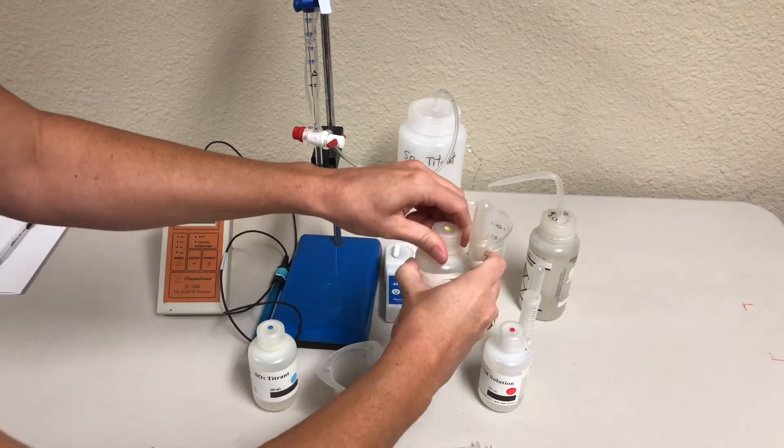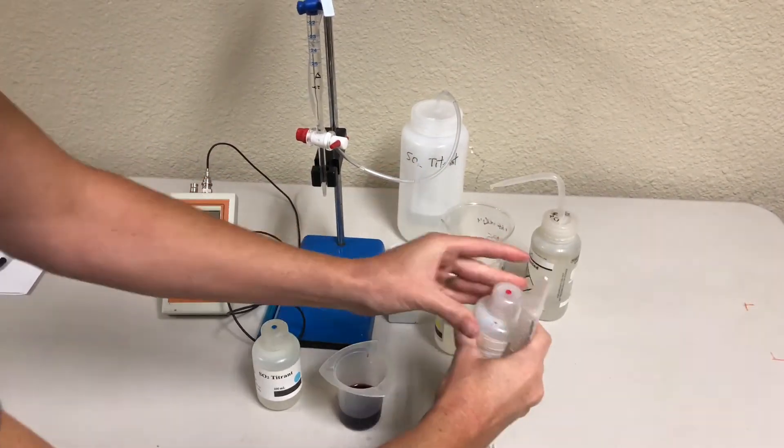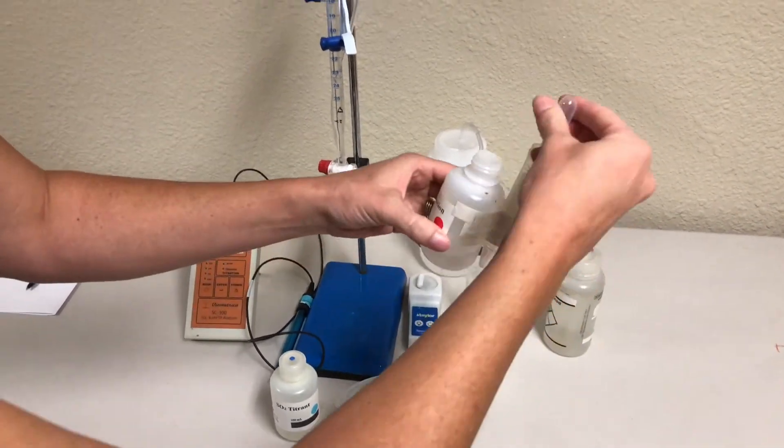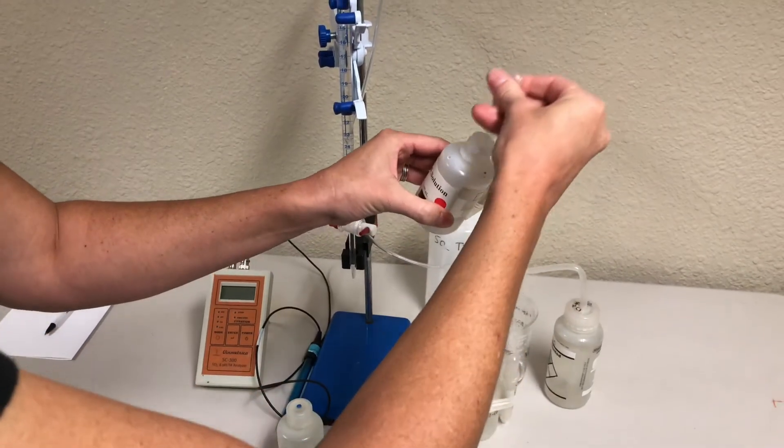Always make sure to recap your reagents when you're done. Again, 2 mils.